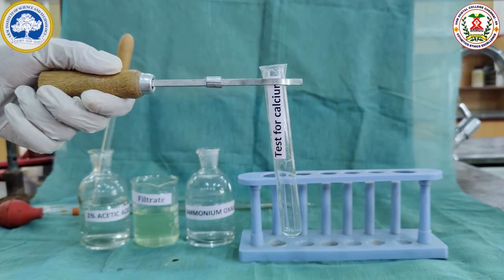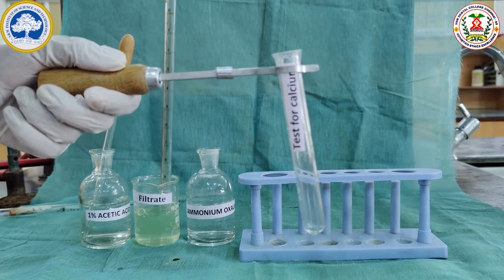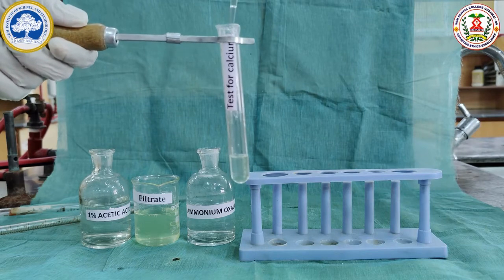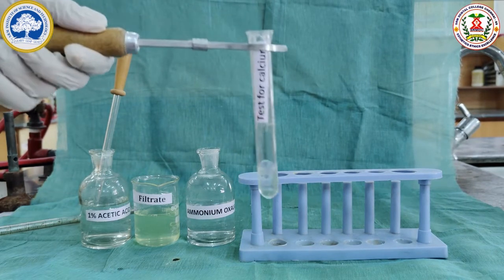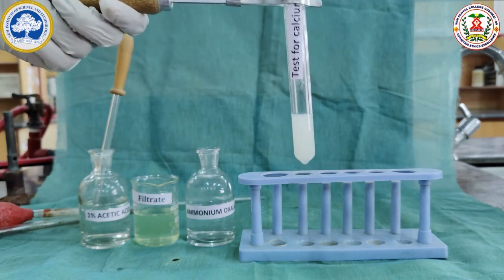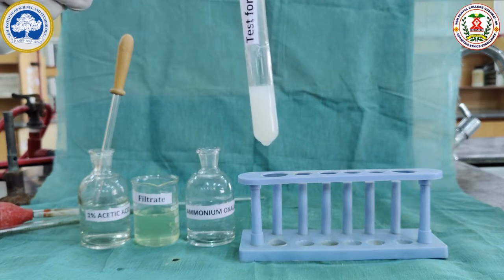The filtrate sample is rich in the mineral calcium. For this, we are going to do the test for calcium. 2 ml of the filtrate sample is taken and acidified with 5 drops of 1% acetic acid. Then, 2 ml of ammonium oxalate is added. We can see the colour change into curdy white, due to the precipitation of calcium as calcium oxalate. On centrifugation, we can see the precipitation of calcium oxalate, which shows the milk filtrate contains the mineral calcium.